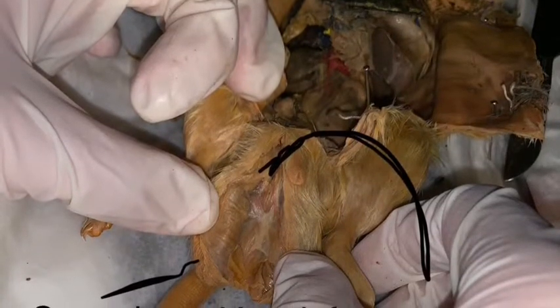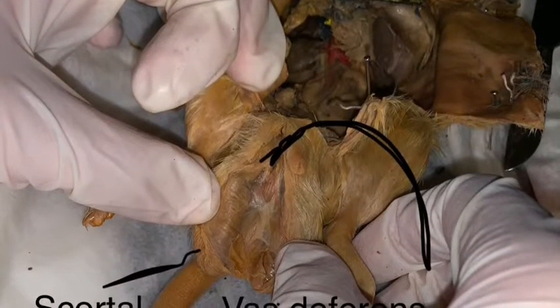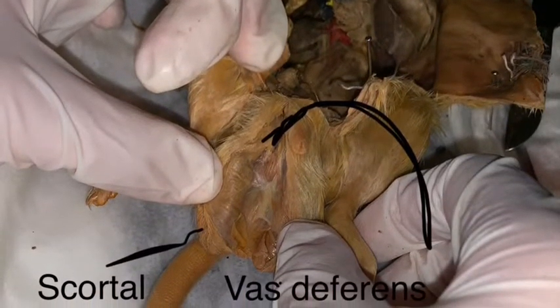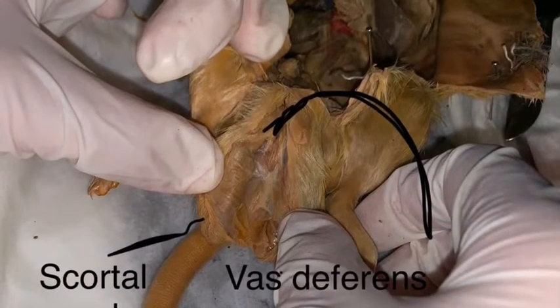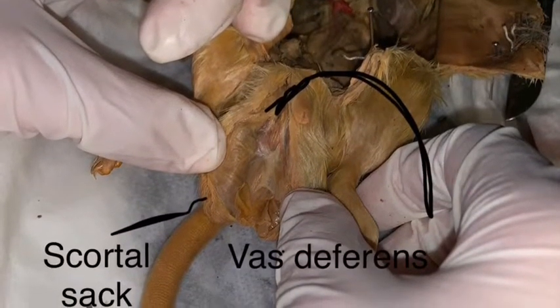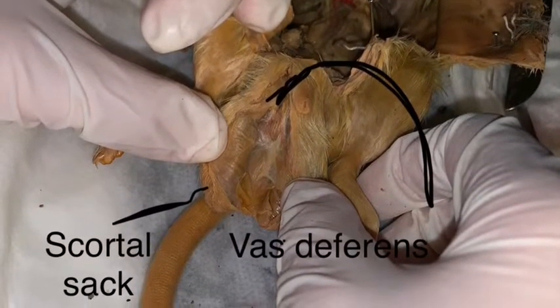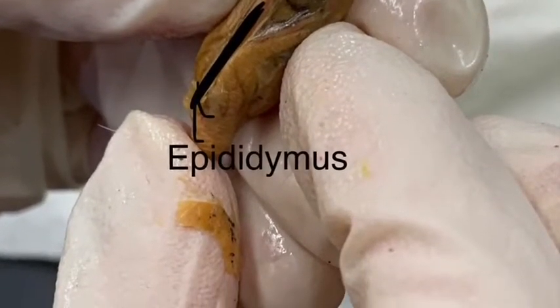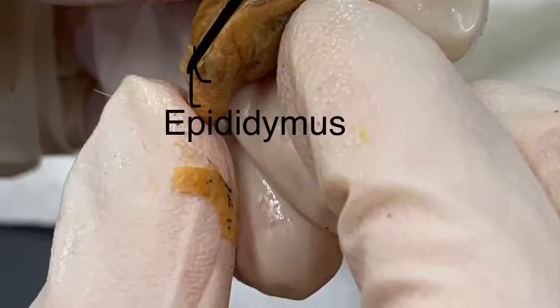The next 2 organs are the vas deferens, which moves sperm or semen to the urethra, and the scrotal sac, which is like a housing for the testicle. Lastly, the epididymis is used to store the sperm that is sent from the testicle.